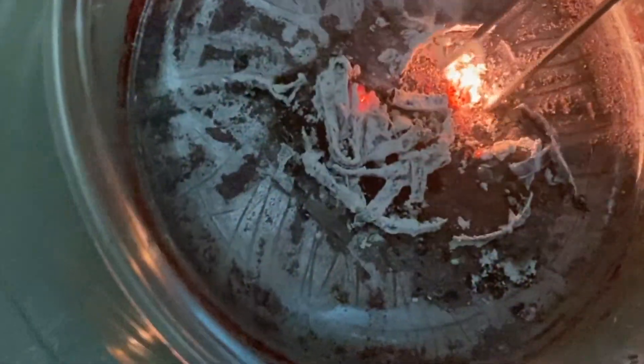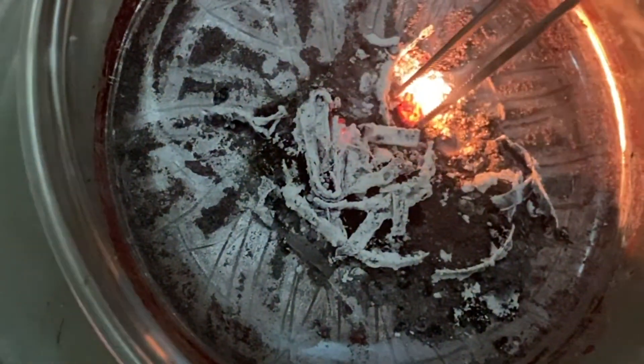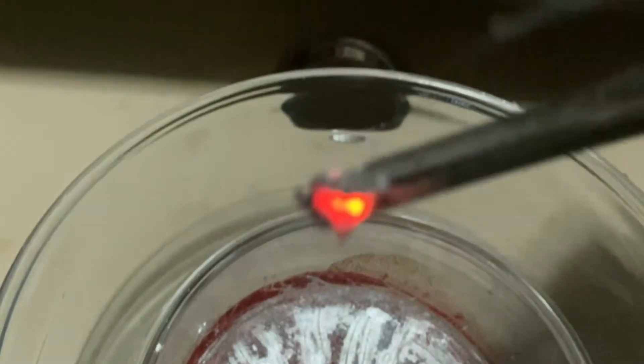While it's still hot, I picked up what I believe is a piece of molten iron, and I just think it's kinda cool.